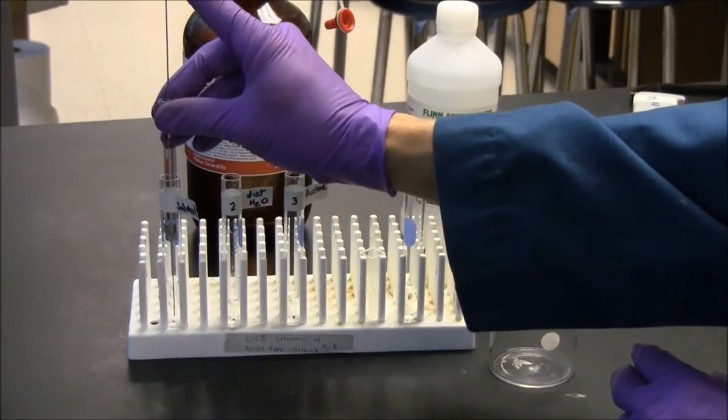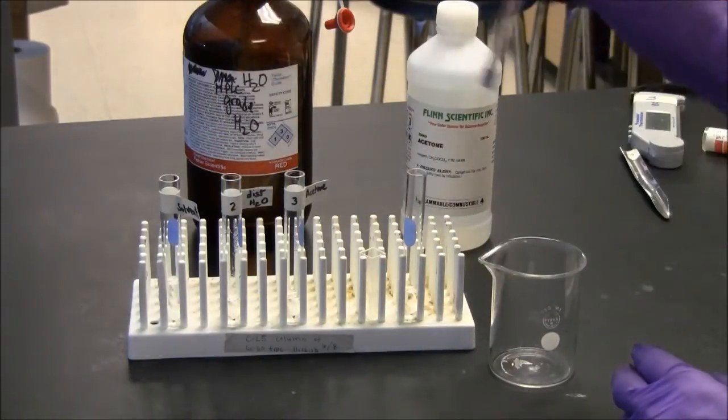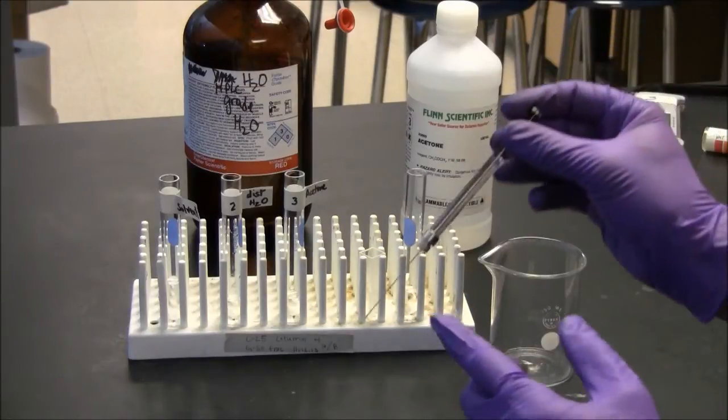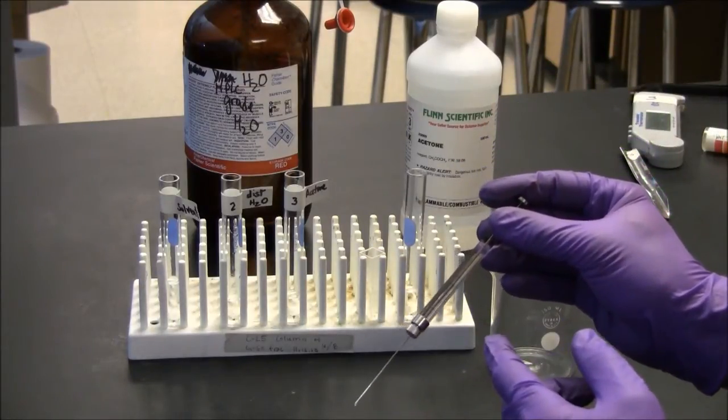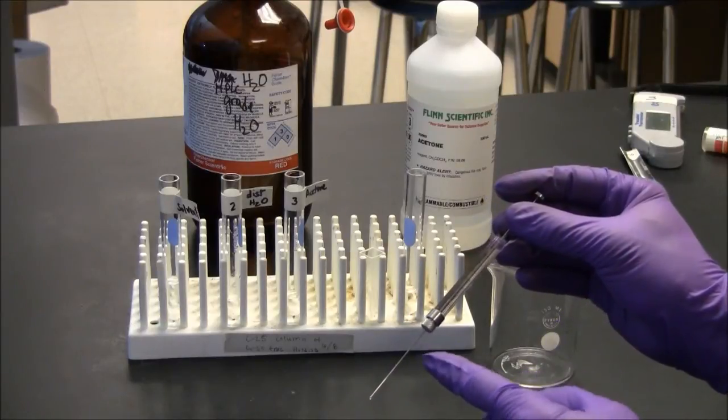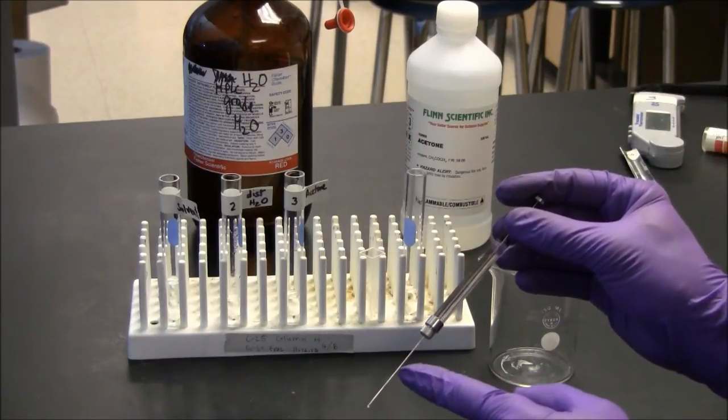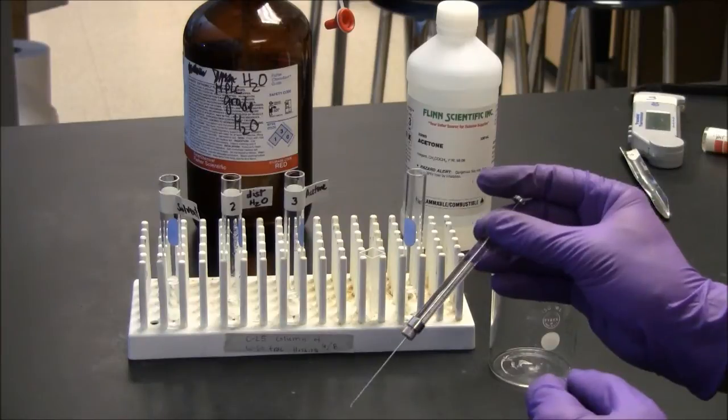What happens with the syringe is the needle gets clogged easily. So if you have a little bit of caffeine, for example, in your original solution, and you don't clean it out thoroughly, then it will crystallize in the needle and the syringe will cease to function.